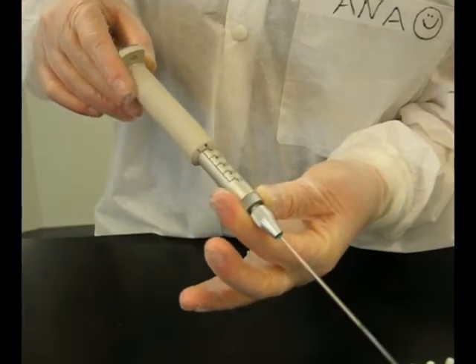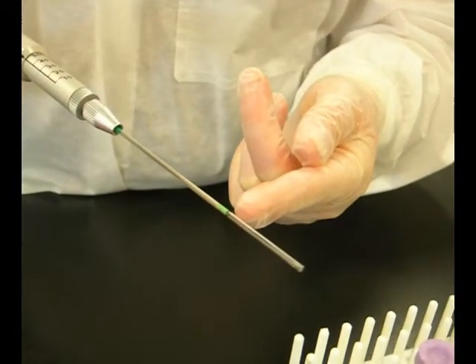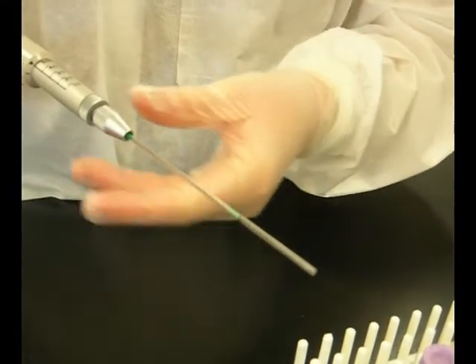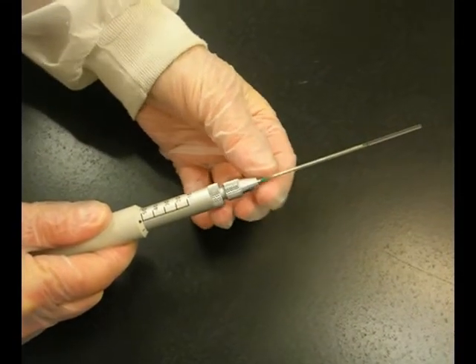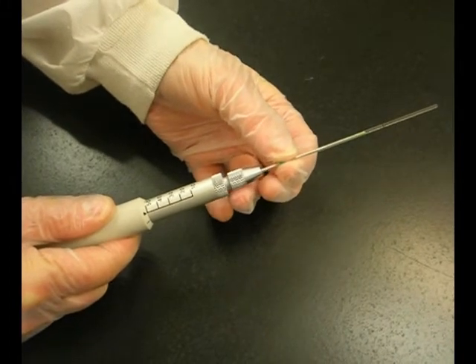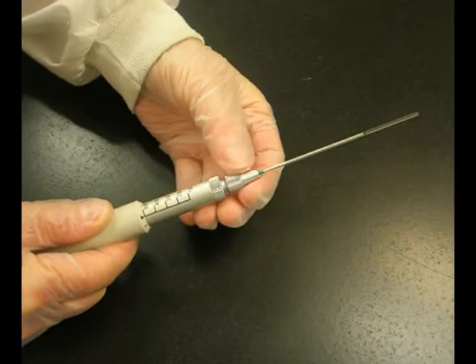Lock the barrel to the 50 microliter line. Press the plunger and verify that the tip of the plunger is aligned with the black line on the capillary tube. If it is not properly calibrated, loosen the screw and slide the capillary tube for proper alignment. Tighten the screw back.